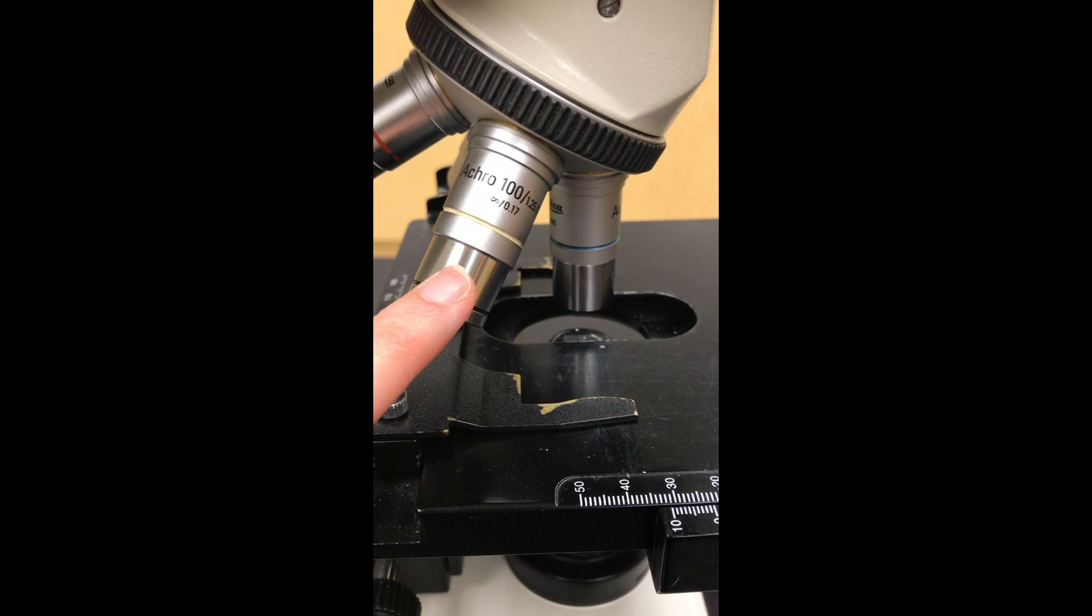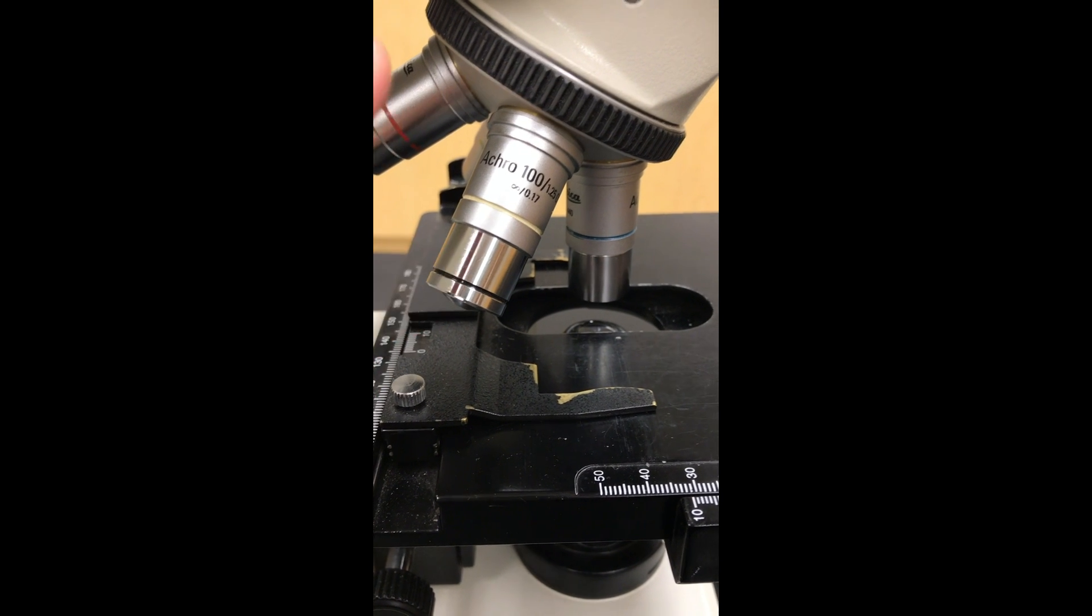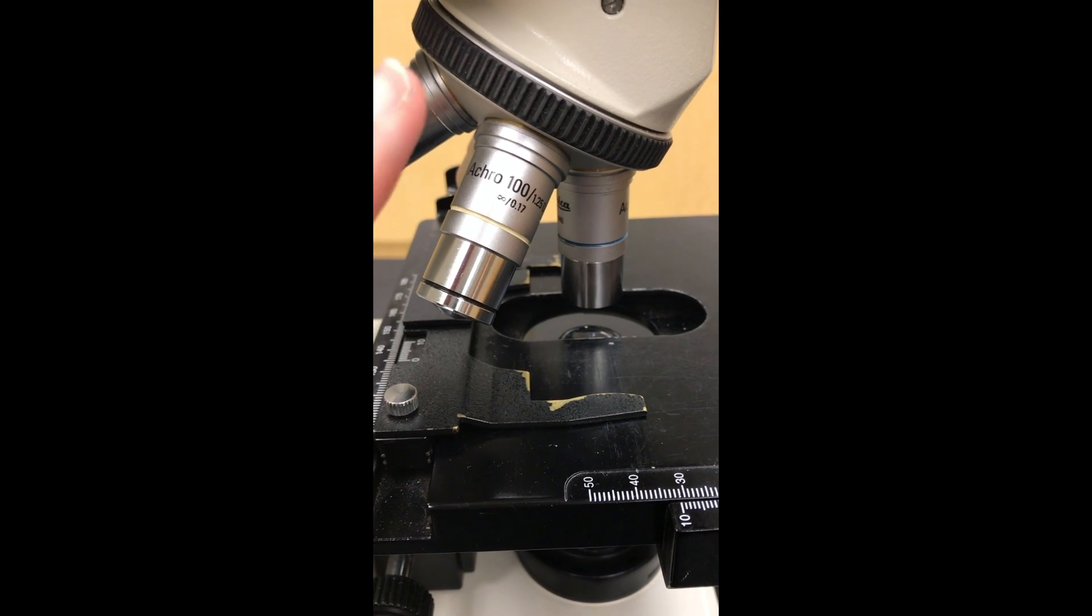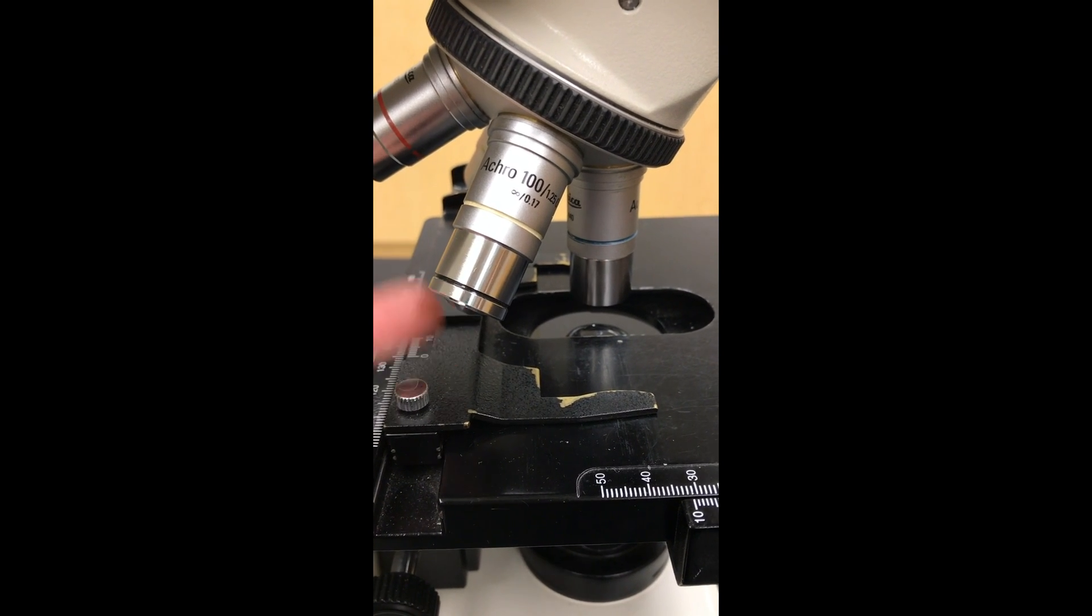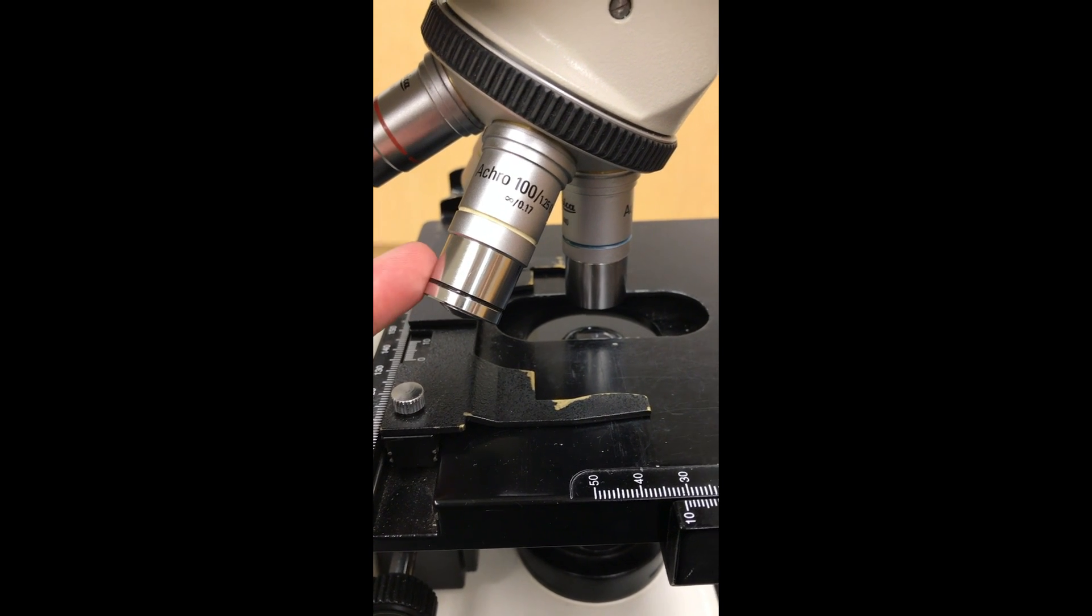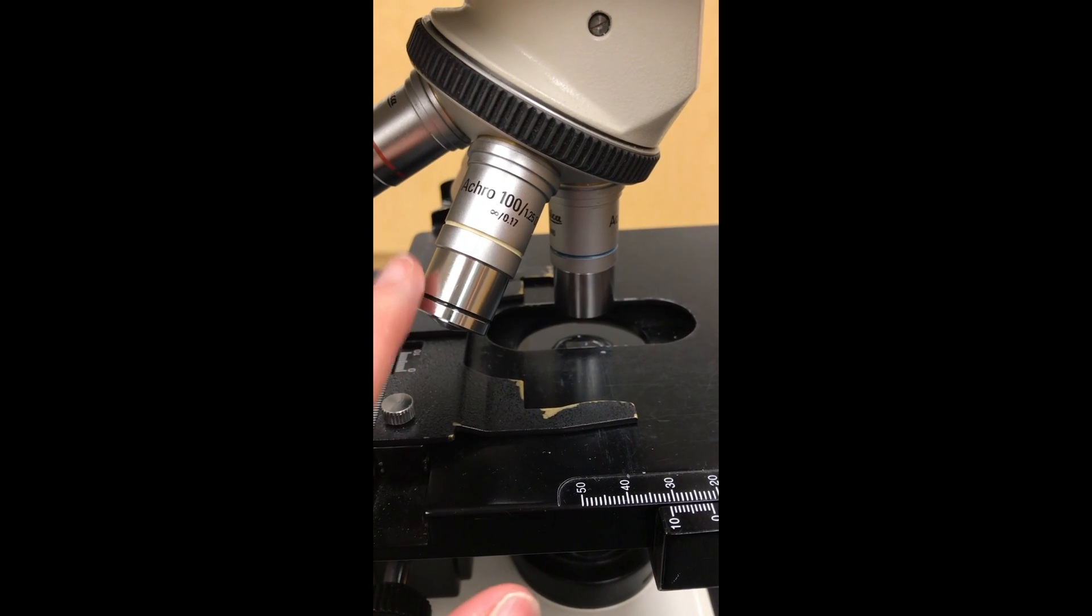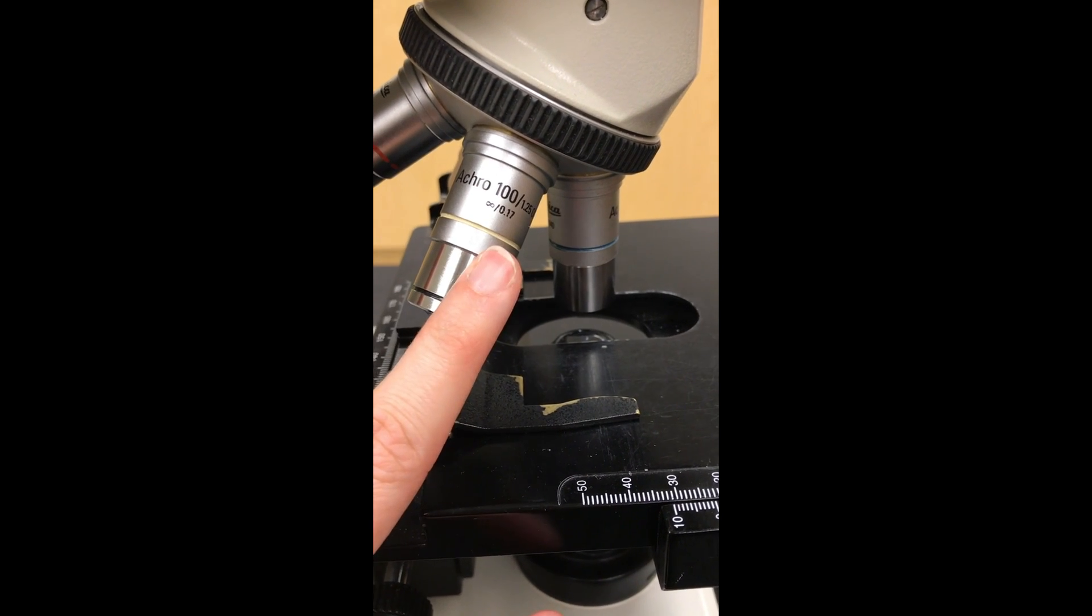Now this objective lens here, this is oil. It's 100x. In this particular class, we do not use it. This is something you're going to use more in microbiology. So we're just going to ignore this whole lens, pretend it doesn't exist.